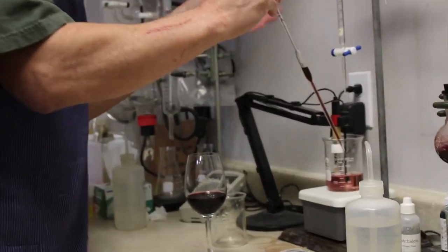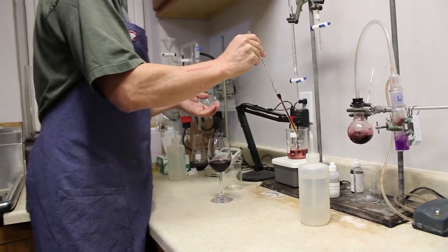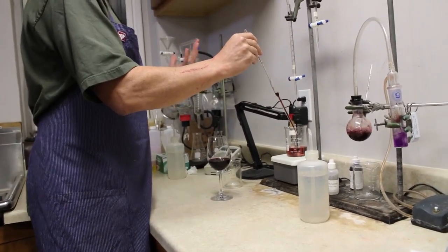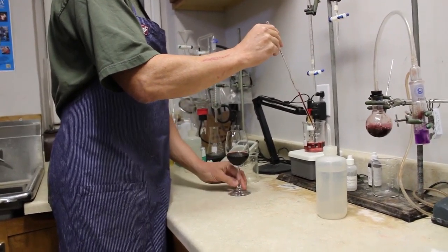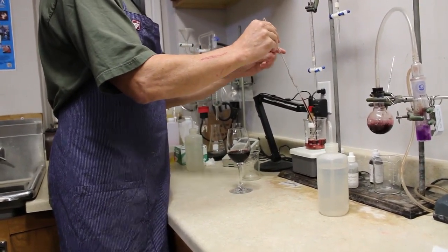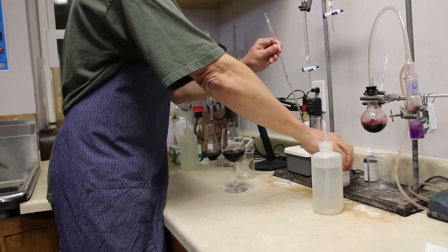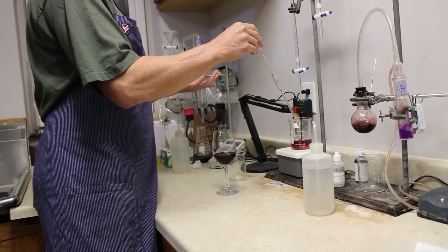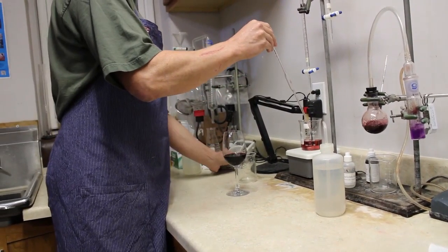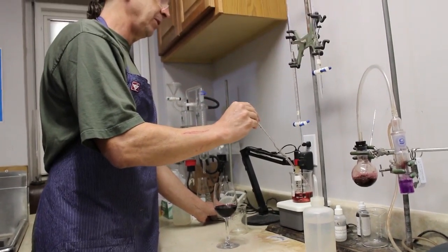What I'm going to do is titrate using the sodium hydroxide to an endpoint. If you remember your high school chemistry class, titrating to an endpoint, if you use something like phenolphthalein, would be titrating to where you get a color change. Well, it's essentially doing the same thing, but in the case of this one, I'm doing it using a pH meter, so I'm looking at the endpoint based on pH.